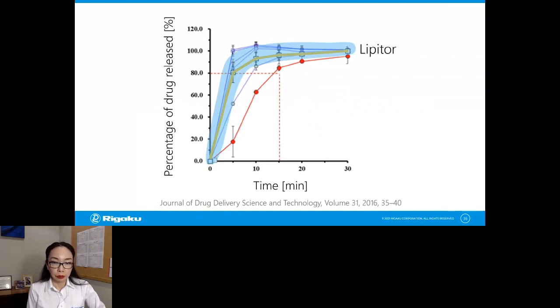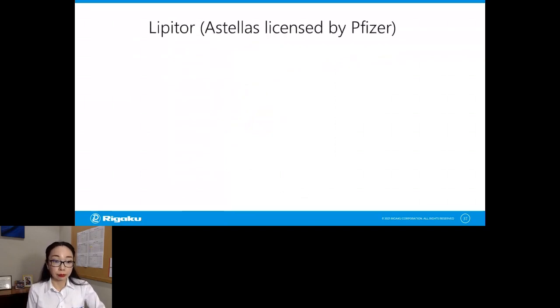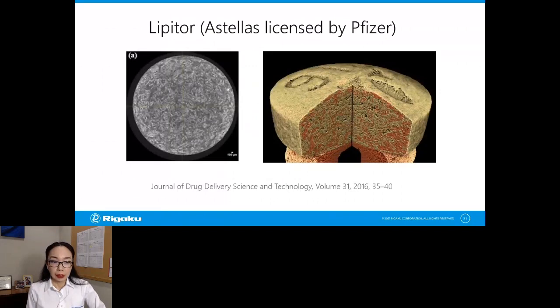Now, to pass as a generic version, you have to reach 80% dissolution, or percentage released, within 15 minutes. And in that sense, all of the curves are passing that test, but this one of the generic versions is barely passing that test. This one is clearly slower than the other generic versions of Lipitor. So let's take a look at both of them, Lipitor and this generic version, and see what's causing this. So first, Lipitor. This is the CT scan of the Lipitor tablet, and this looks very clean to me. I don't see any cracks or aggregates, and everything seems to be mixed very uniformly.